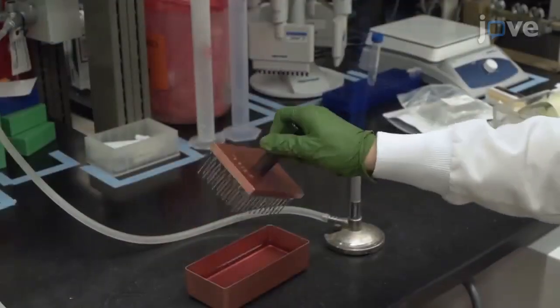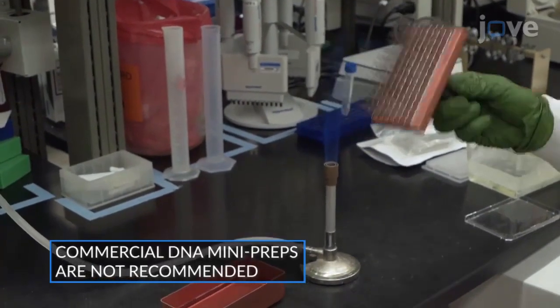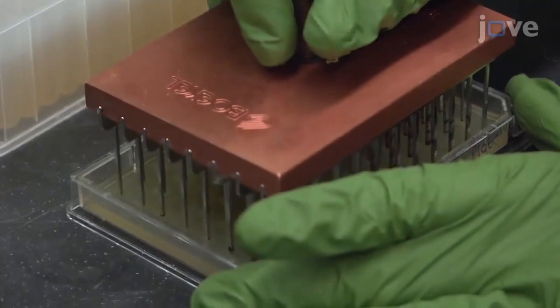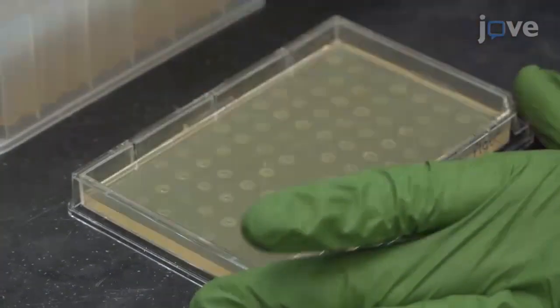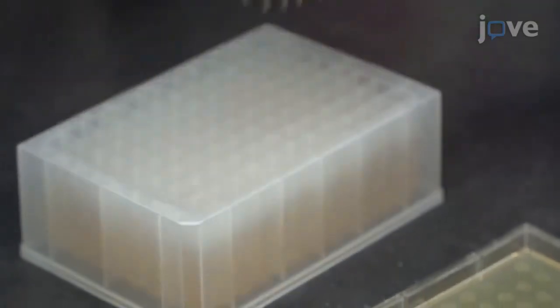Then, sterilize a 96-pin device with 80% ethanol and flame. Use the sterile 96-pin device to pick colonies from the overnight incubated agar plate and submerge into the wells of the deep well plate to inoculate the culture.